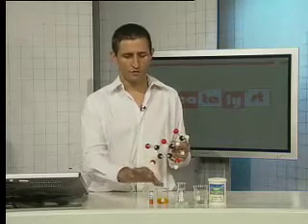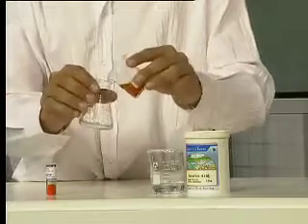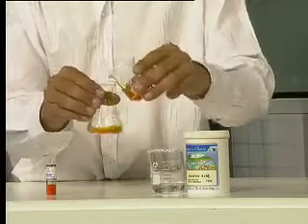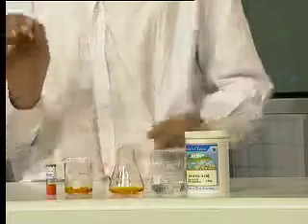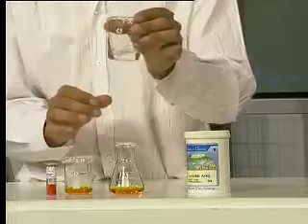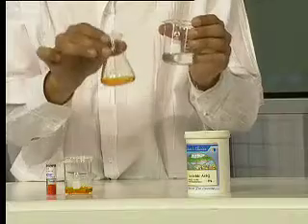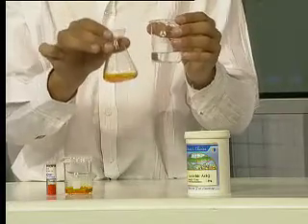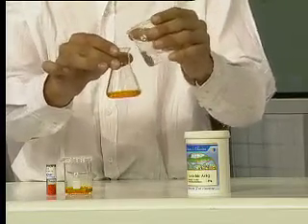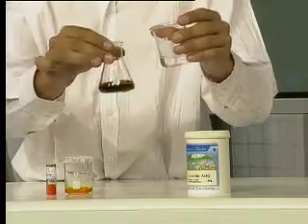I've got a nice visual way to see the reaction happening. My oxidizing agent, potassium dichromate, is a nice orange color initially. We're going to place that inside a conical flask and watch what happens when I introduce some ascorbic acid — which is what your body uses to neutralize harmful oxidizing agents. I've got a solution of water and ascorbic acid. We should see something visual happening. We've got chromium 6+, and as I add the ascorbic acid, you should notice a very sudden color change.